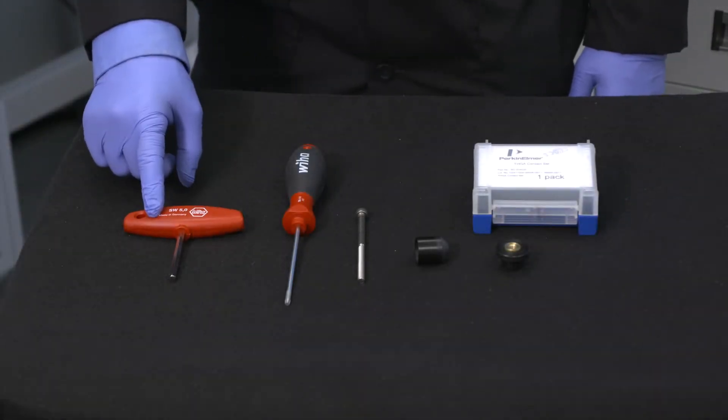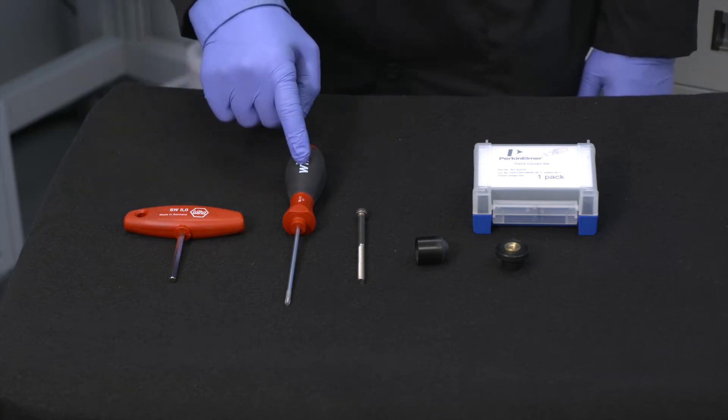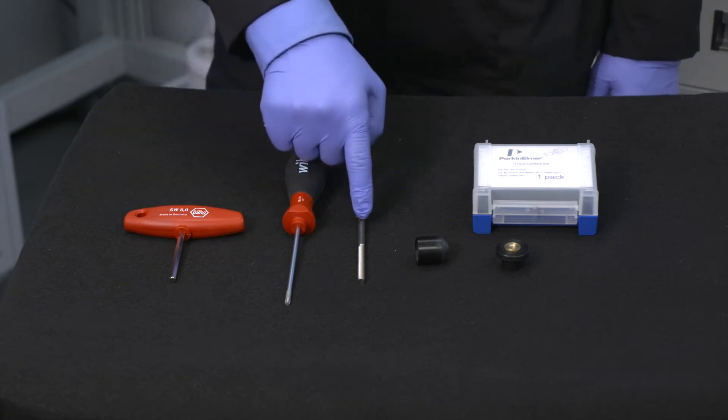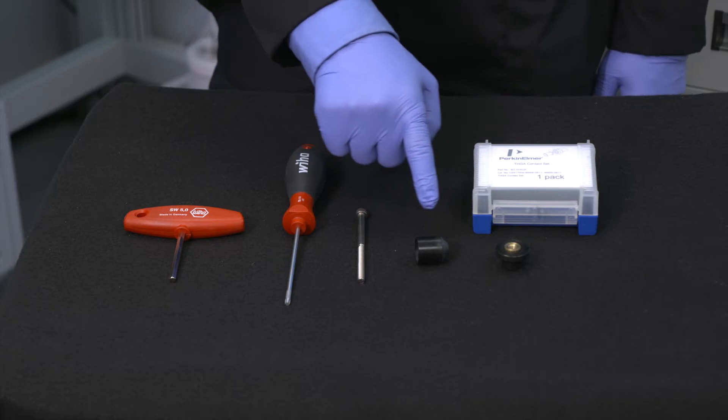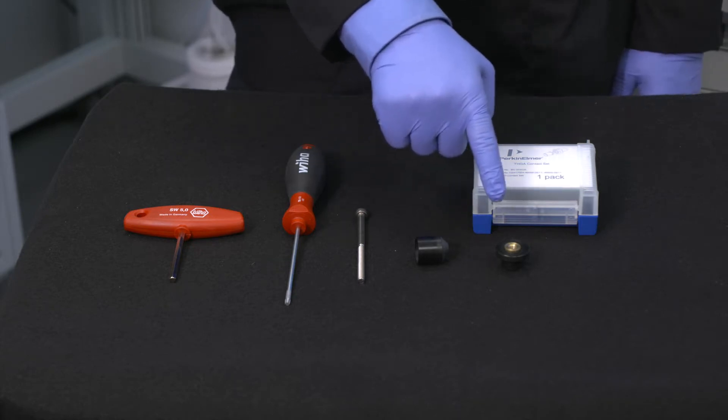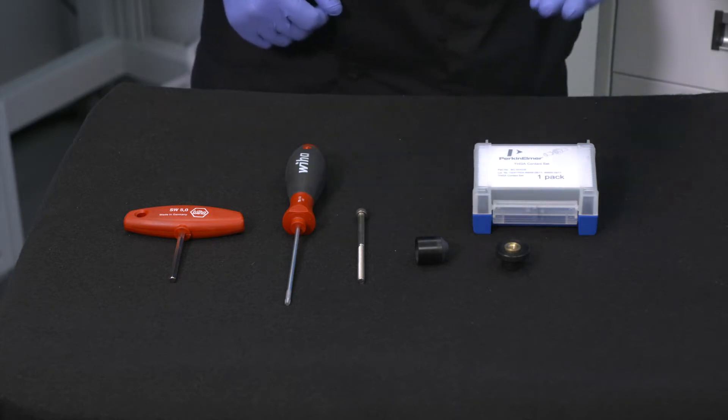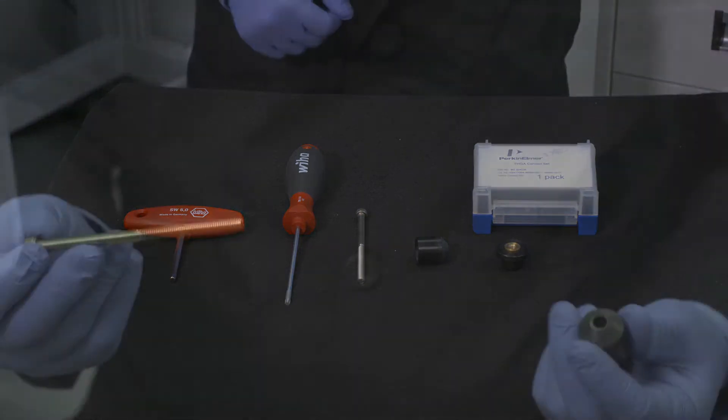We'll need a hex driver, torx driver, long bolt, front contact alignment, and threaded adapter, as well as a contact set.